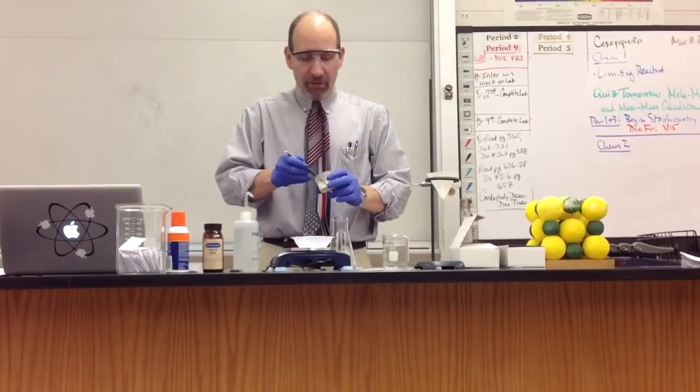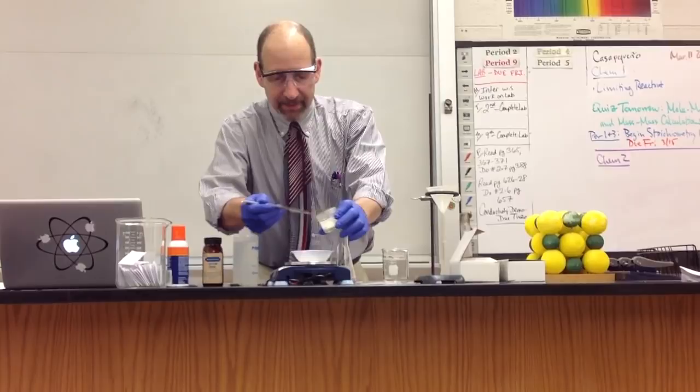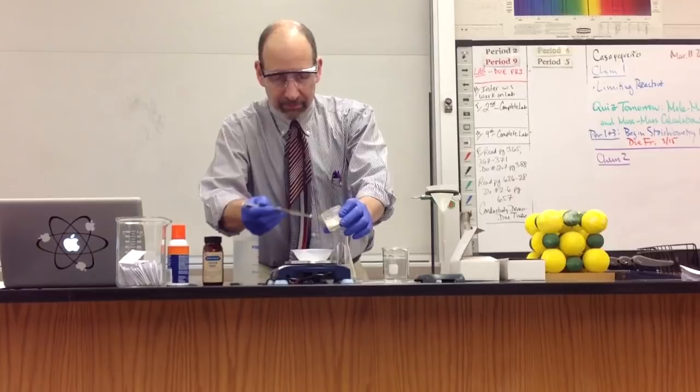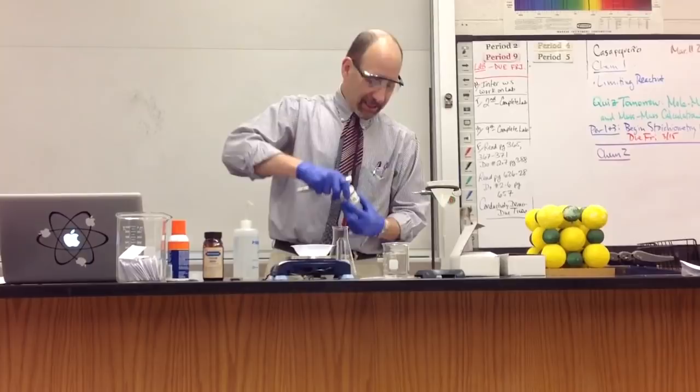So I'm going to start off with 1.66 grams. I'm going to look for a little bit more than that. By the way, I'm wearing my gloves because this is a lead salt, and lead salts are all poisonous if we ingest them. Okay, so 1.71 grams, that fits the bill, right? 1.66 plus 0.05. That's the lead salt.